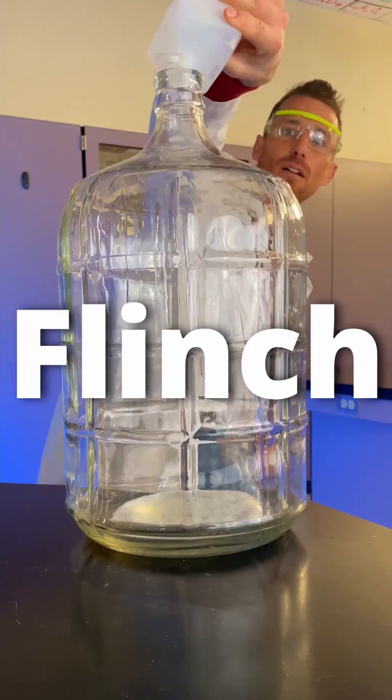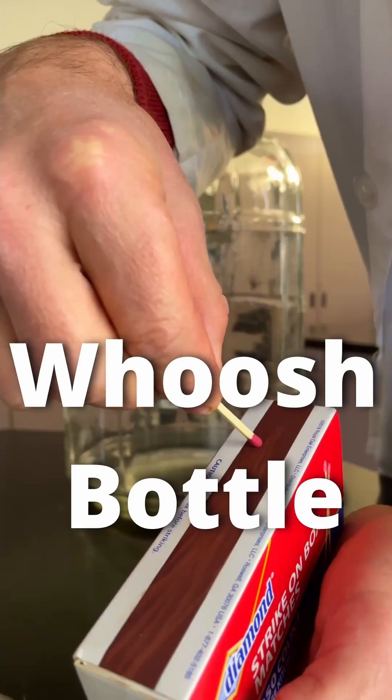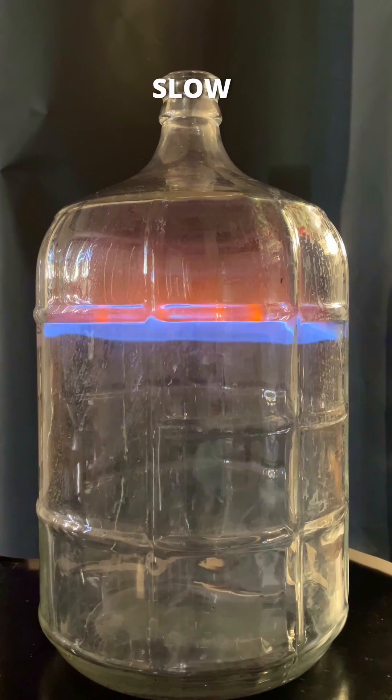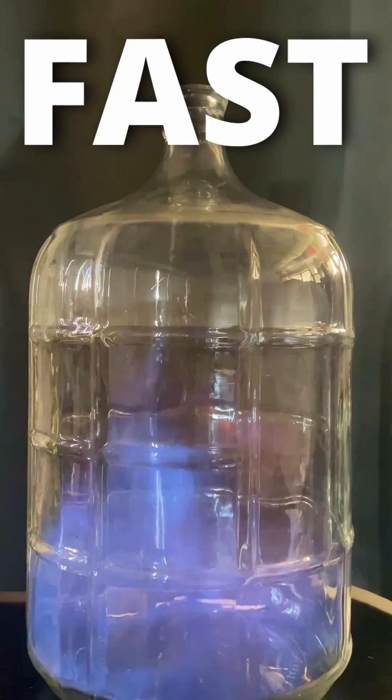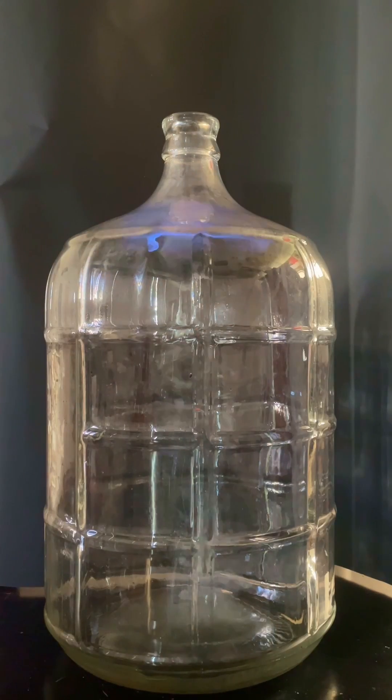Without further ado, try not to flinch. This is a whoosh bottle. Sometimes it has a slow reaction, sometimes it has a fast reaction. Then you get all kinds of reactions in the middle.